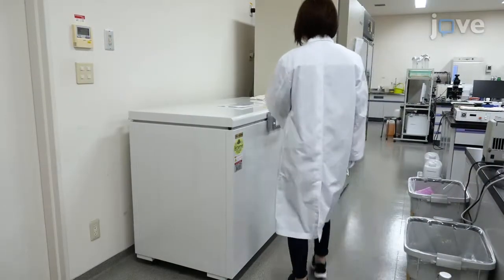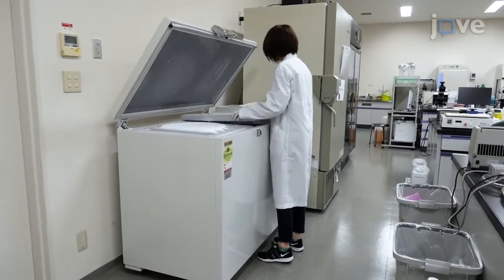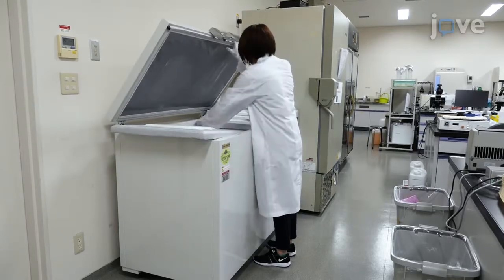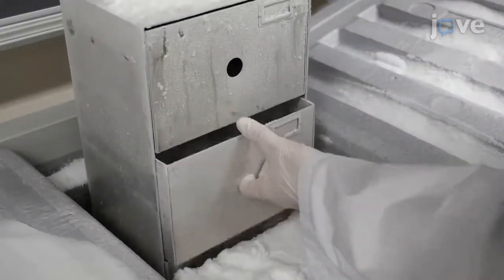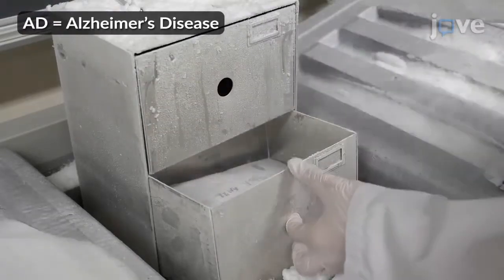Obtain human cortical specimens for IMS from brains that were removed, processed, and stored at minus 80 degrees Celsius within 8 hours post-mortem. Take the brain specimen from the occipital cortex of AD patients and age-matched controls.